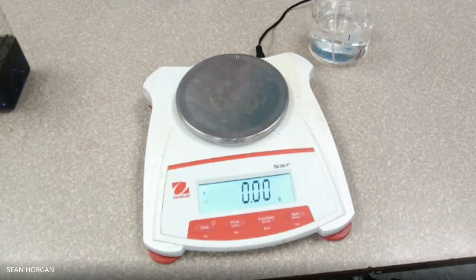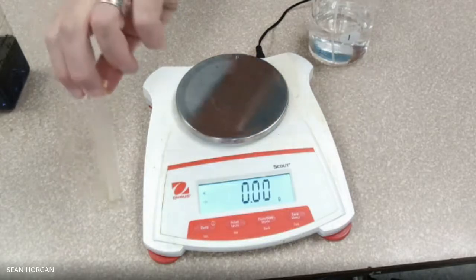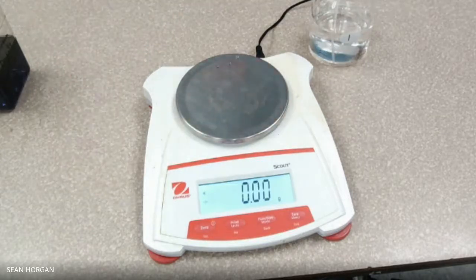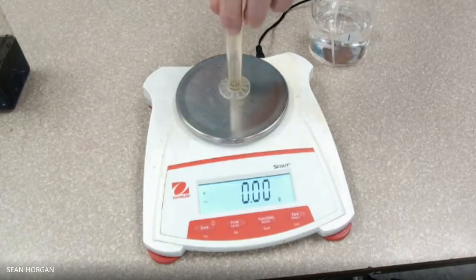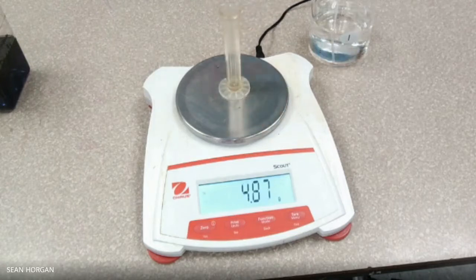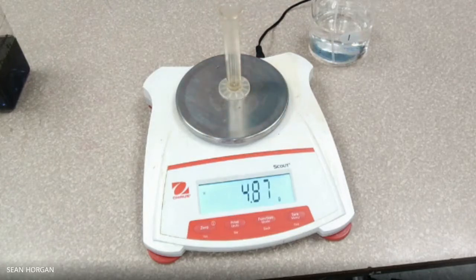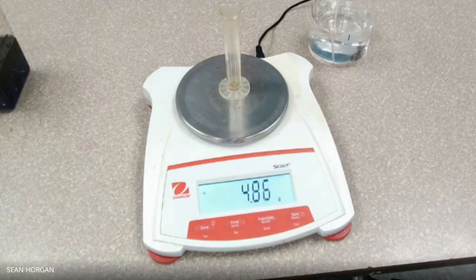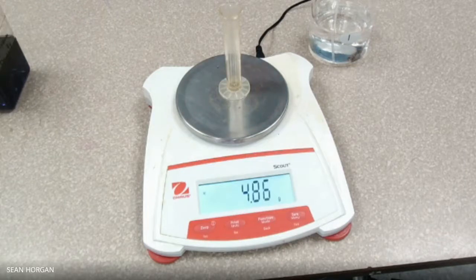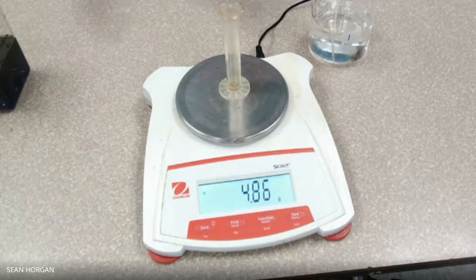Each time we go ahead and put the volume inside our graduated cylinder, we're going to measure the mass. So the first thing we'll do is take a reading of just the empty graduated cylinder, because we're going to add water and we only want to get the mass of the volume inside the graduated cylinder, not the graduated cylinder itself.